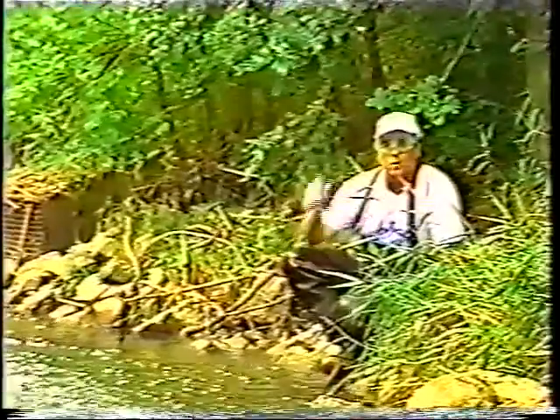The pH that you report will be the mode pH. That is the pH value that shows up the most. You're not going to take an average of this data. Rather, you're going to just record the mode as the pH of the stream. Remember again, mode is the number that shows up the most frequently. Okay, mode, most. That's the way to remember that. And that's what you need to do for your pH. When you're finished, return the cap and turn the pH meter off, and then put it in a safe place.